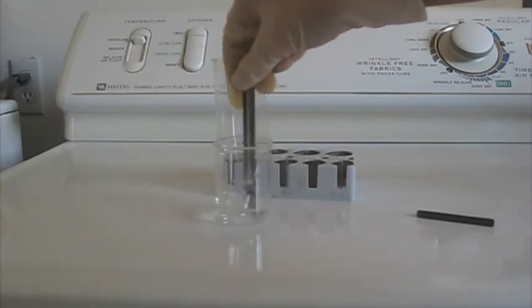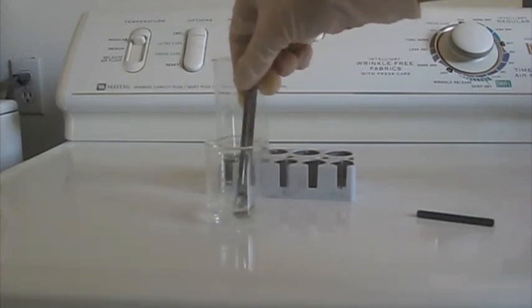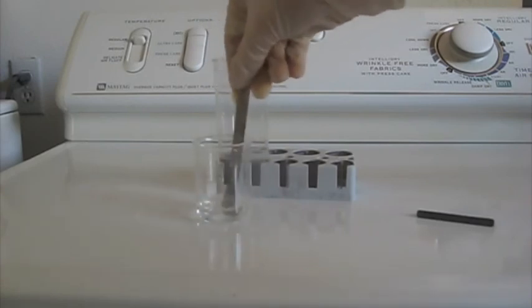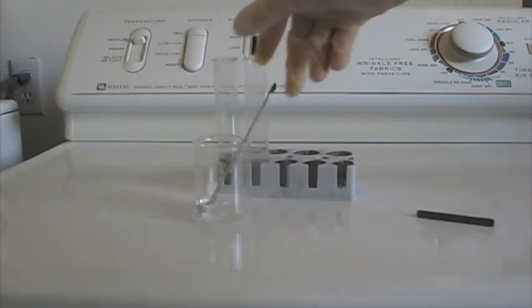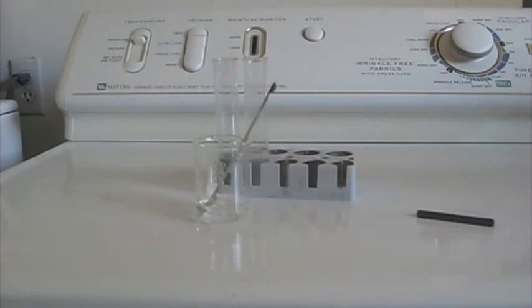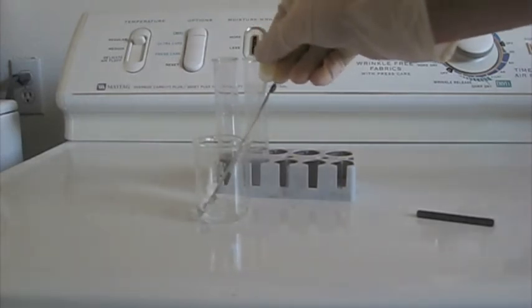Make sure you dissolve your sodium hydrogen sulfate. According to what I think, the more concentrated the solution of sodium hydrogen sulfate, the faster the iodine clock reaction will occur.